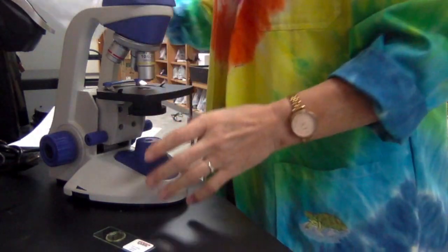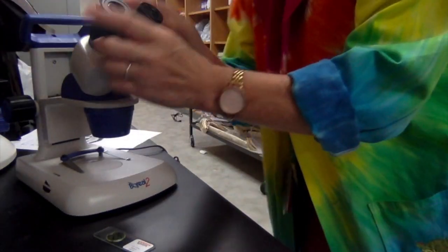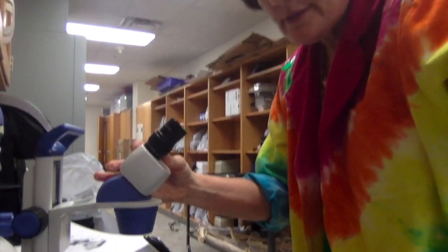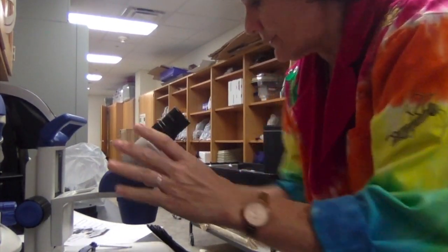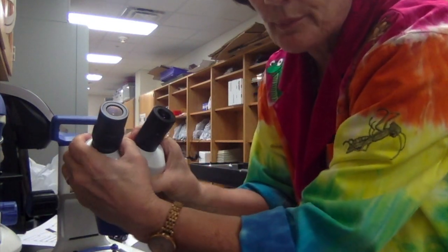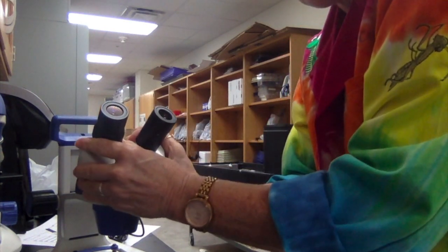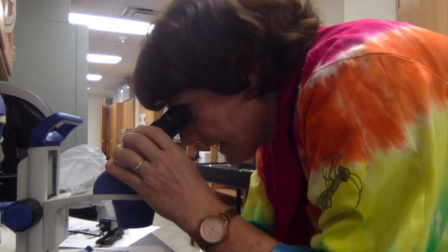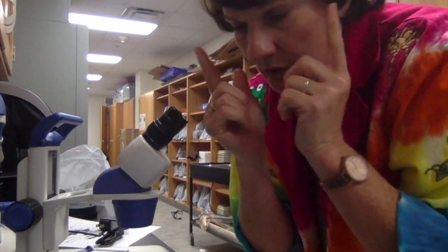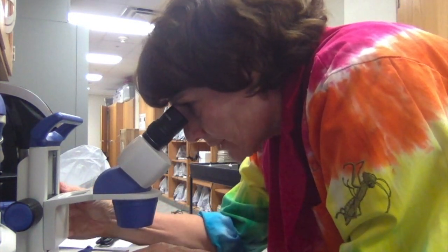I want to show you another microscope which is really cool to use, and it's the binocular microscope or the dissecting microscope. And this microscope is really fun because it has two eyepieces here, which make it a little different. And so on this one, you've got it plugged in and everything, but you use these two eyepieces, and notice that they can move apart. The two eyepieces have a power of 10 times, and when we pull them apart, you want to adjust them for your eyes. So if your eyes are further apart or closer together until they come into focus really well. And you only have one adjustment on this one, a coarse adjustment.